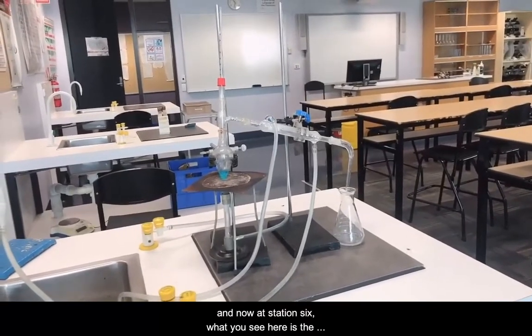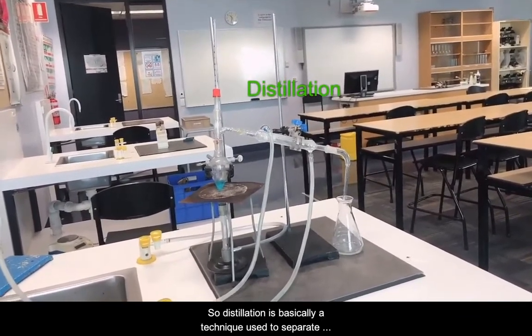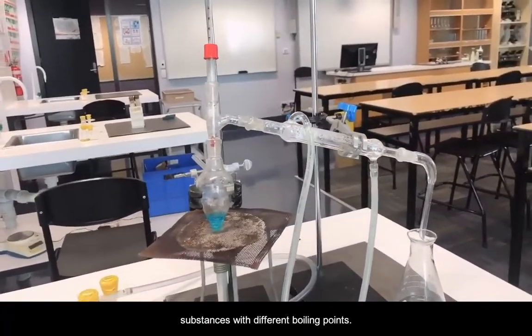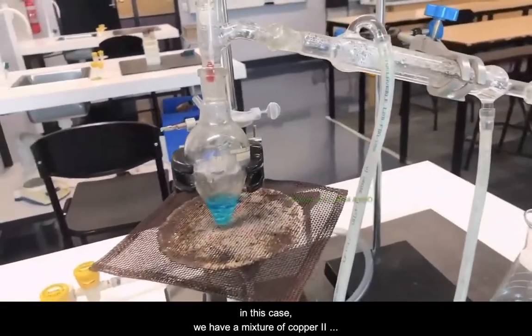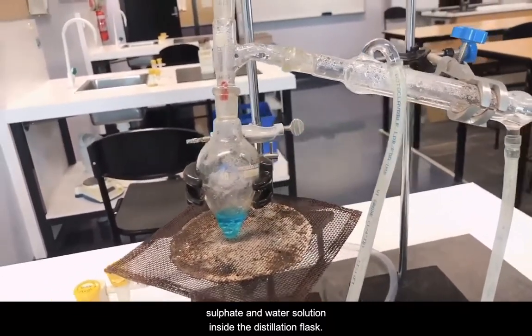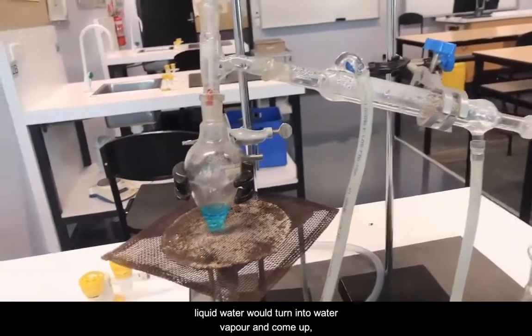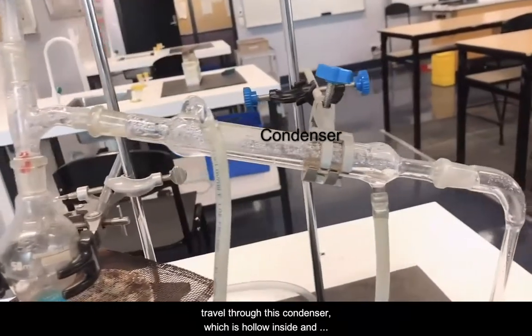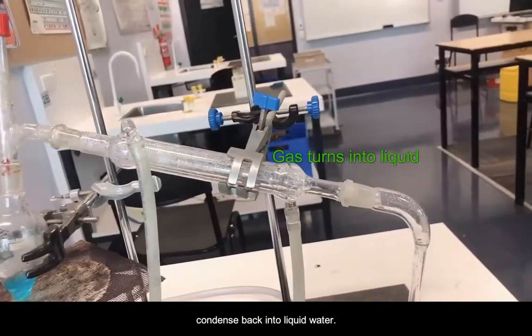And now at station 6. What you see here is the equipment used for the distillation technique. So distillation is basically a technique used to separate substances with different boiling points. In this case, we have a mixture of copper(II) sulfate and water solution inside the distillation flask. When the temperature has reached 100 degrees, liquid water would turn into water vapor and come up, travel through this condenser, which is hollow inside, and condense back into liquid water.